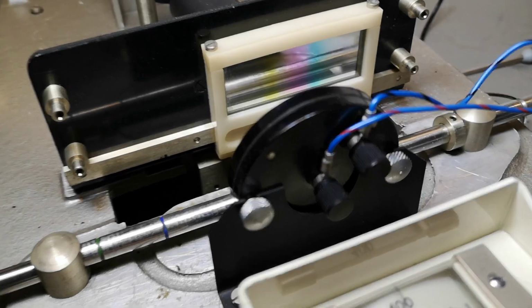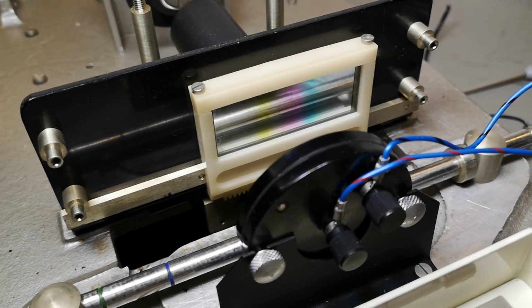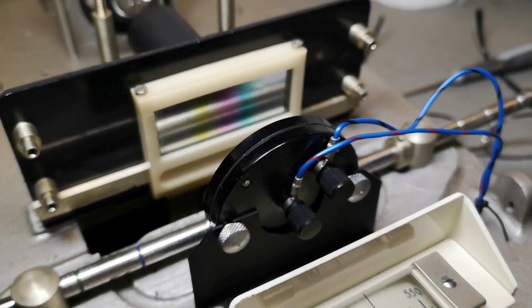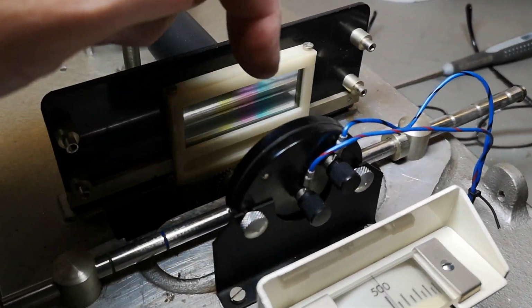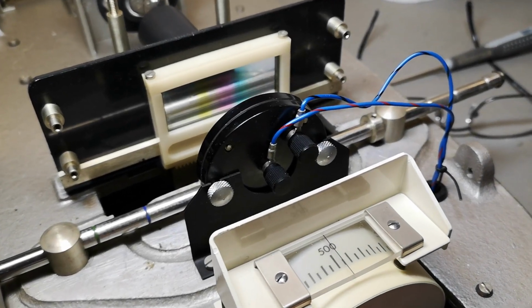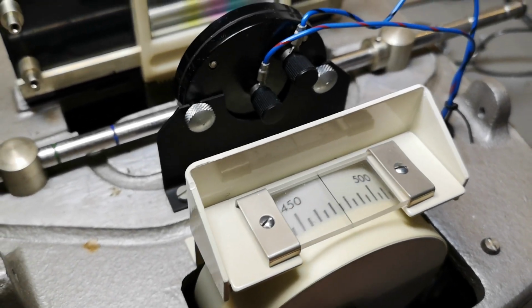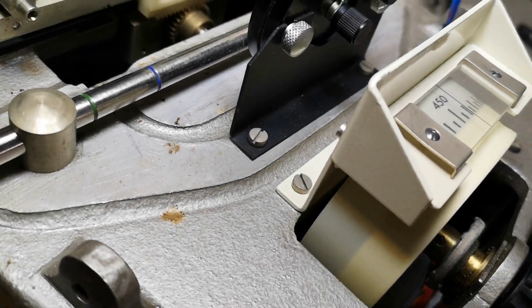And here we go with the... I actually got some high precision filters. I know exactly what kind of wavelengths they peak, because I do also play with optics and stuff like that now and then, and my plan is to test those and see how it all peaks up, if it's exactly at the right wavelength. Otherwise, I think there's a possibility to fine-tune here by moving the scale somehow, right? How do you calibrate this thing?